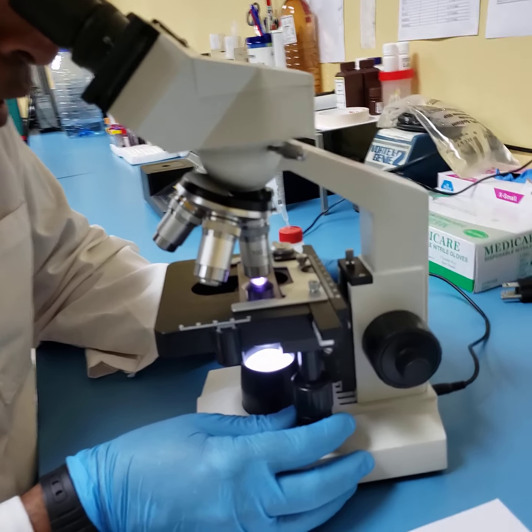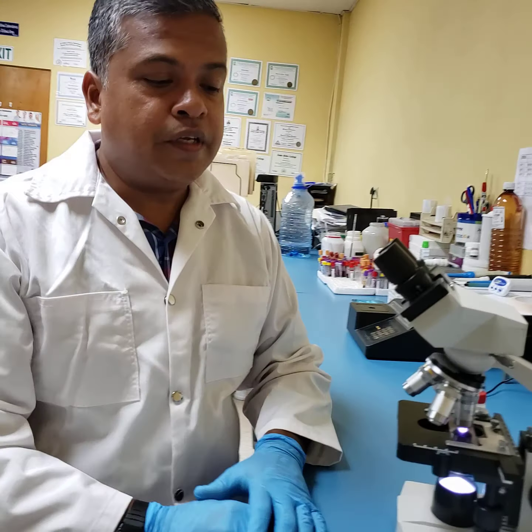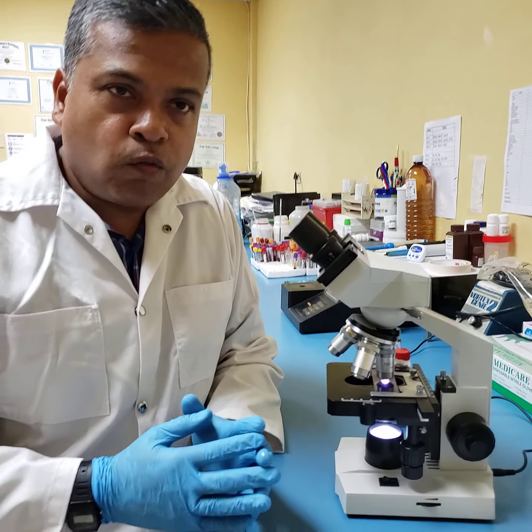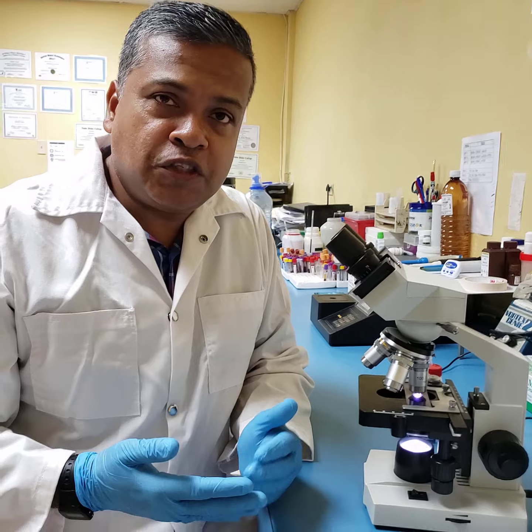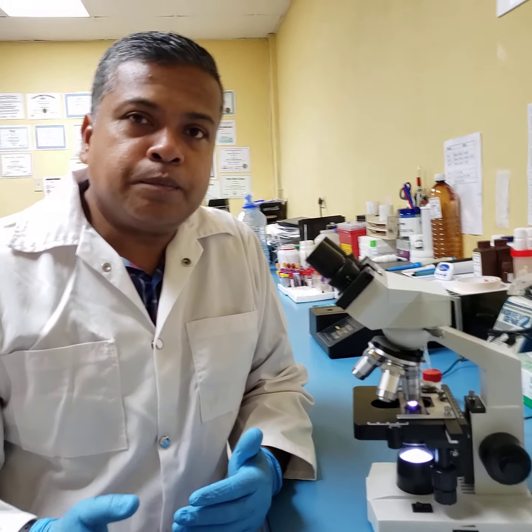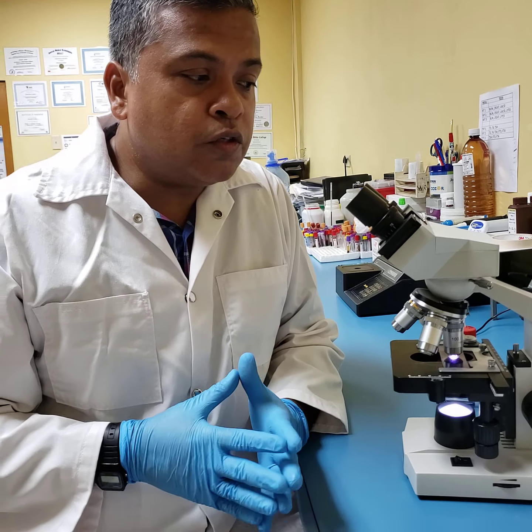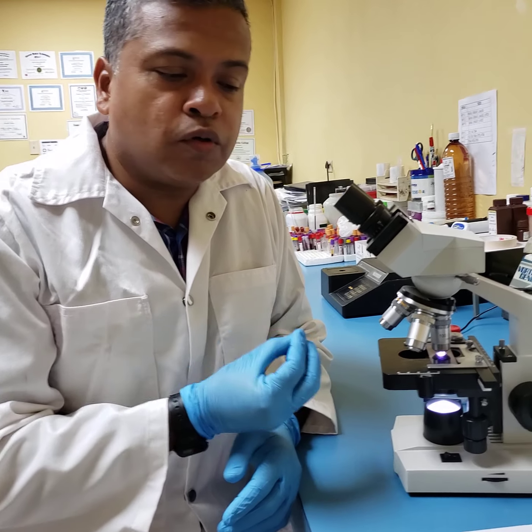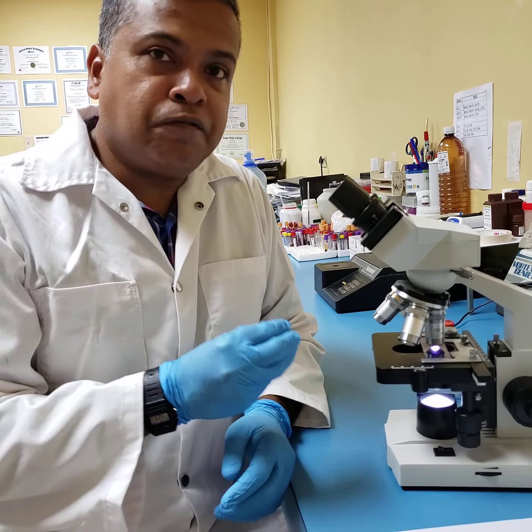observation now. All right, so now what we have done here is covered the use of the microscope. You may ask yourself, when do we actually use the times 10, the times 40, which is the high dry, or even the oil? That will be looked at in another session, but for now I just wanted to utilize these few minutes to introduce you to the light microscope, one of the most important tools in the medical laboratory, its basic design and its function.